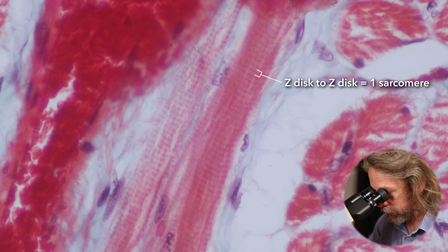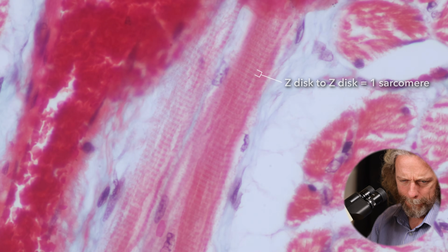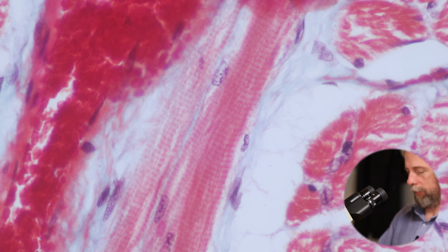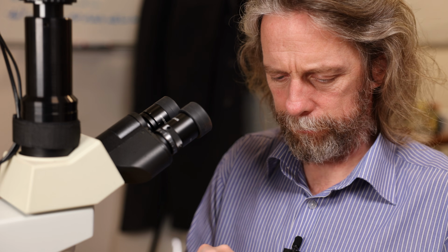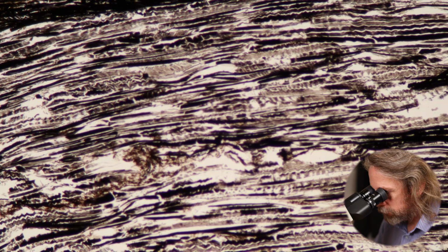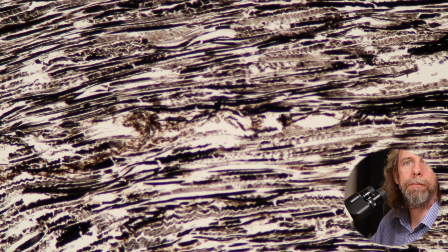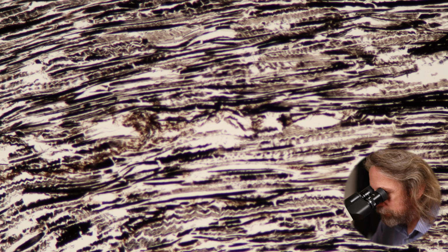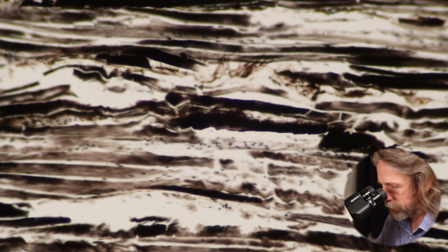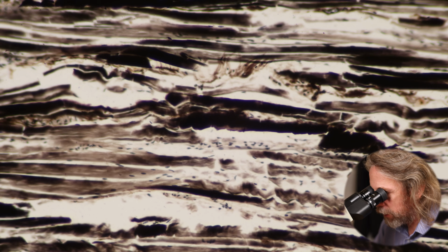That's the best one I'm going to find on there, isn't it? So let's have a look at the silver stain. Yeah? So this is very black. You know, I assume this is a silver stain. I don't know what it is. But silver is one of the things, yeah.